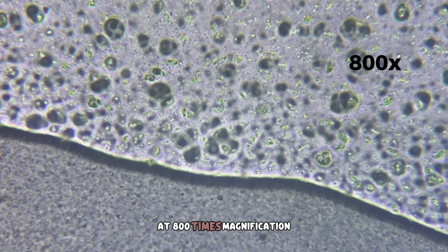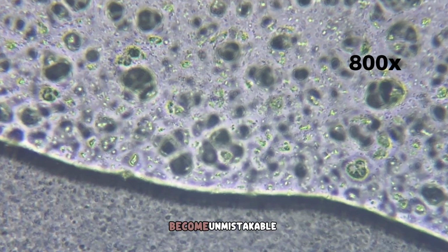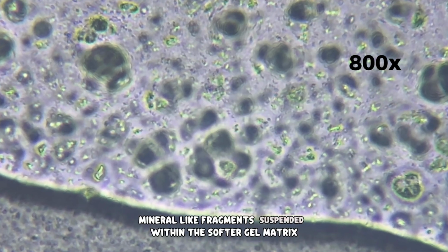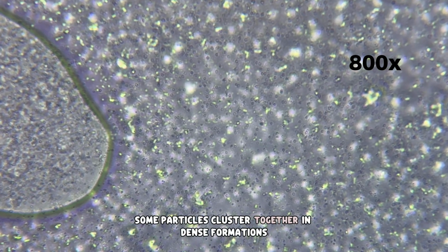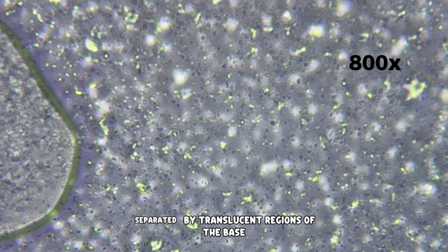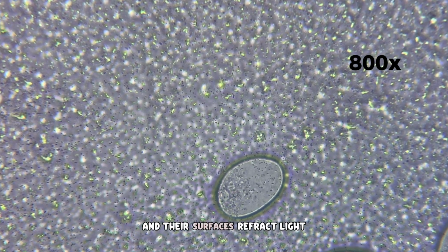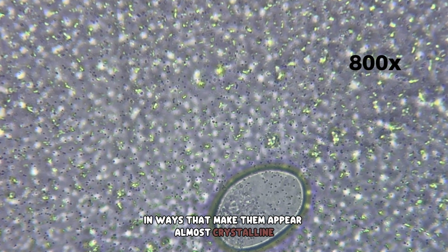At 800 times magnification, the abrasive particles that give toothpaste its cleaning power become unmistakable. They dominate the frame, appearing as irregular, mineral-like fragments suspended within the softer gel matrix. Some particles cluster together in dense formations, while others remain isolated, separated by translucent regions of the base. Their edges are sharply contoured, and their surfaces refract light in ways that make them appear almost crystalline.